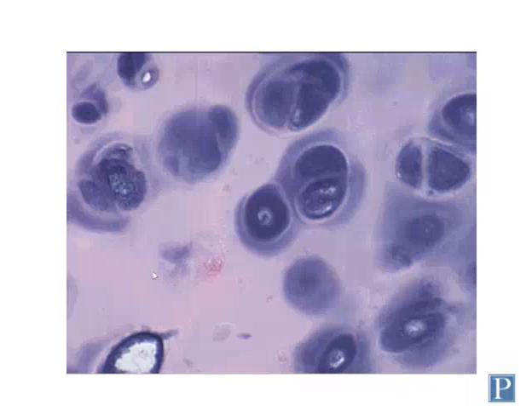Here's a closer look at the mature cartilage. You can see the larger chondrocytes here that are found in these holes or depressions called lacunae. So chondroblasts and chondrocytes are found in lacunae because the matrix is solid, not liquid. The cells, after they lay down the matrix, become trapped with this solid matrix surrounding them. So the little holes or depressions where the cells live are called lacunae.